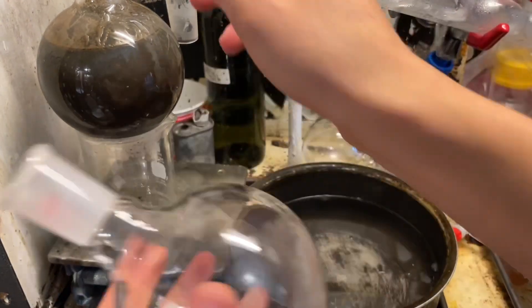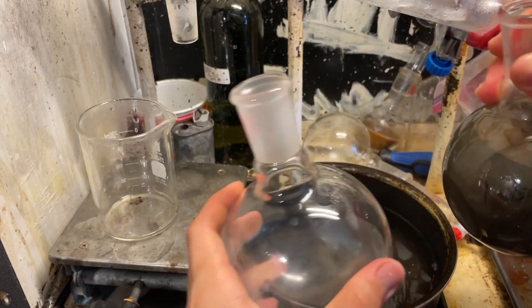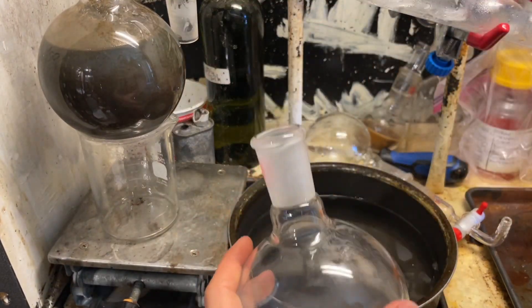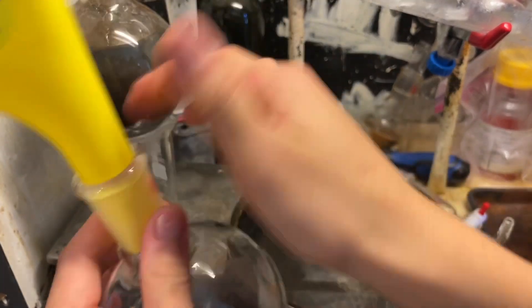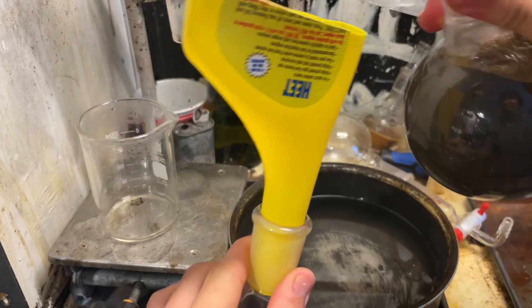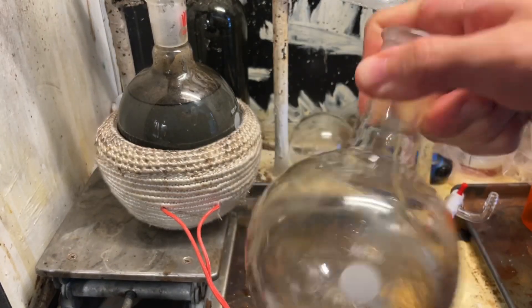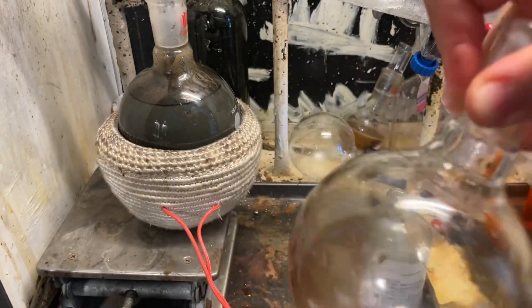The etched one — don't want to ruin the good ones. Probably going to use a funnel; I don't want to seize the joints. The plastic's going to reek after this, but I can always just make another funnel. So we'll just pour this in.